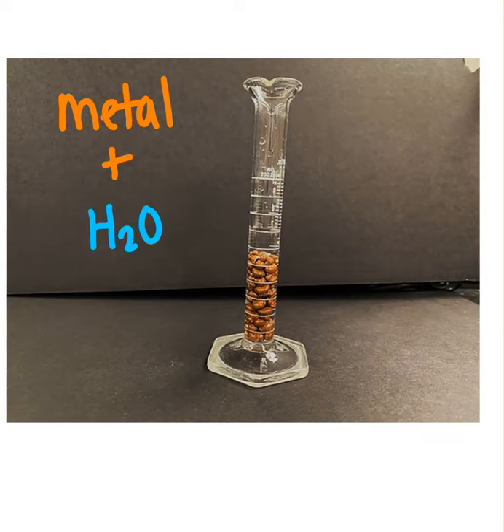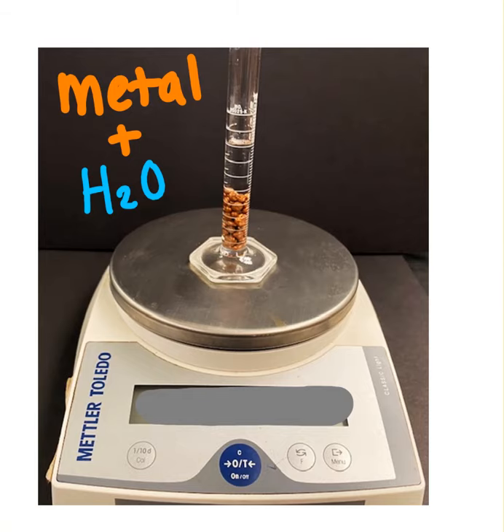Next, we took that same graduated cylinder and we added this metal into it. And the metal displaces the water, so the water level rises up, and we're going to measure that. So we're going to measure this, read off this volume. This will be your data point D. So they may not be in order, watch for that.